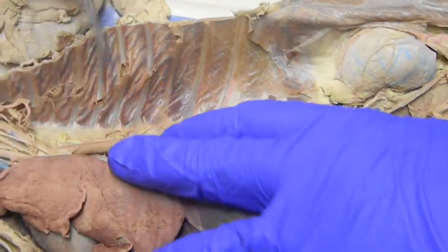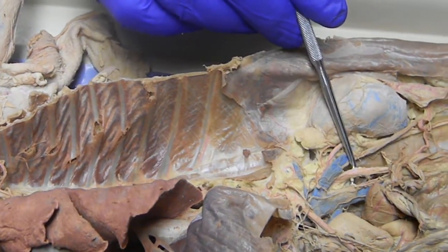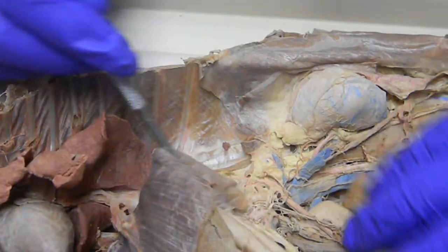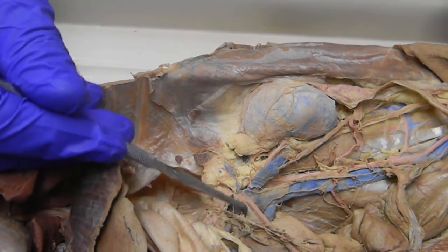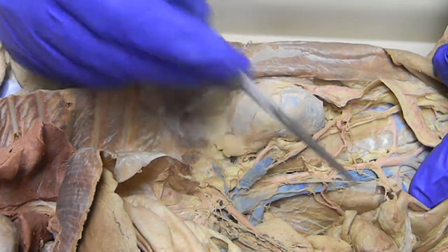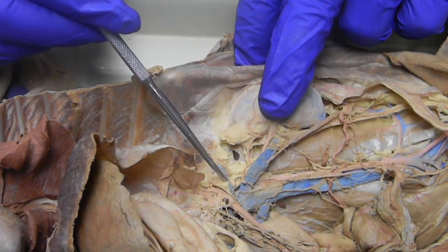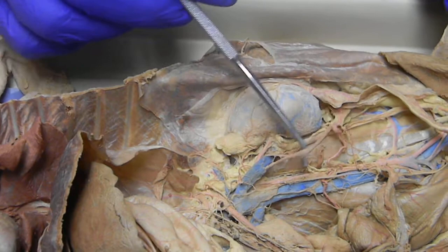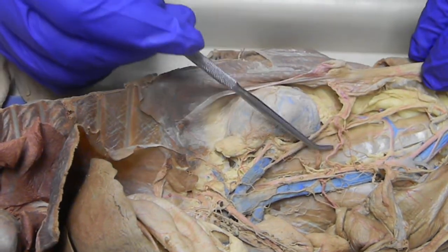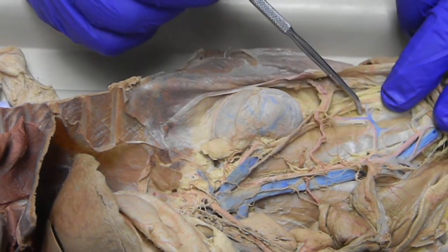Below the level of the heart, we have the inferior vena cava. And coming down through the thoracic area is the thoracic aorta. When it penetrates the diaphragm, it now becomes the abdominal aorta. And here's the inferior vena cava again. We have three arteries that come up to the viscera. The first branch right here is the celiac. The next branch is the superior mesenteric. And the one that goes to the colon is the inferior mesenteric. Along the body wall, we have across the adrenal gland the adrenal lumbar vein — the artery is underneath. The renal artery and vein. Coming off the renal vein on this side usually is one of the genital veins. You can also see the genital artery here going over to the ovary. Along the back body wall is the iliolumbar artery and vein.